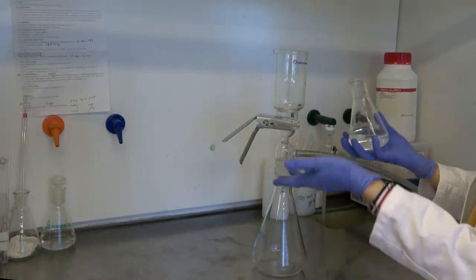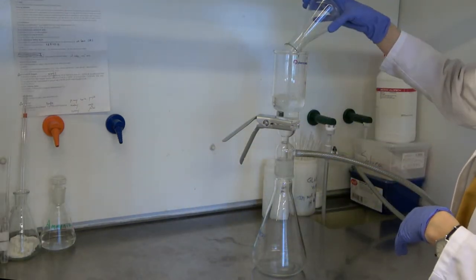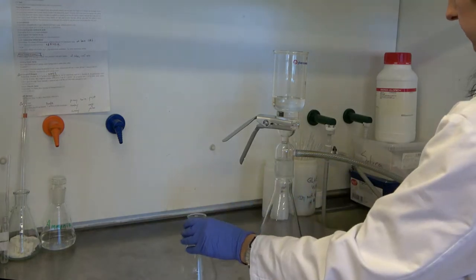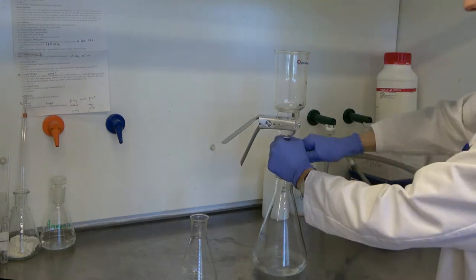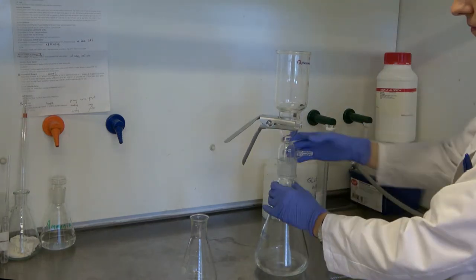The solution to be filtered is poured into the top and filtered over into the collection flask where it's been rid of all potential contaminants. The solution can then be poured into a clean beaker for further use.